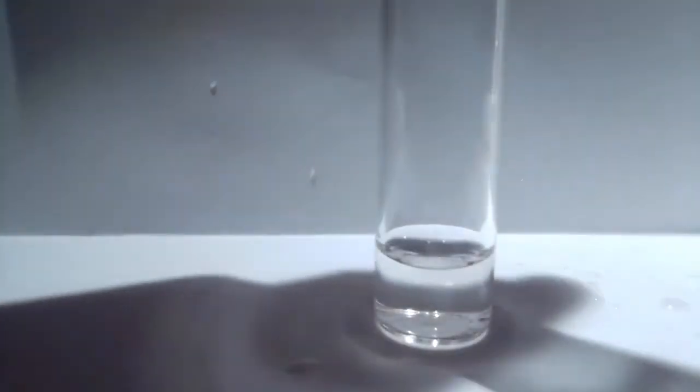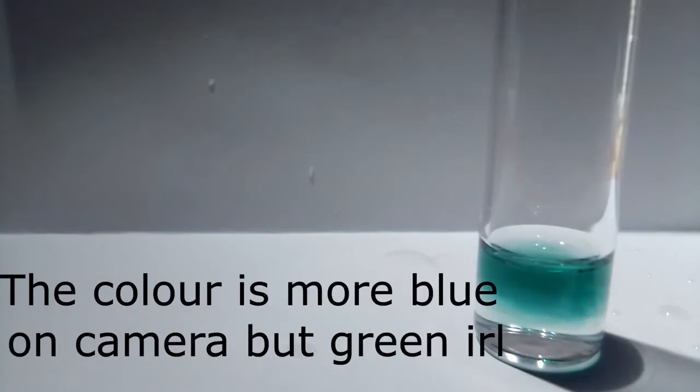And now I'm just going to pour some bleach. Now I'm going to drop in some urea. You can definitely see the green color developing. It's quite pretty.